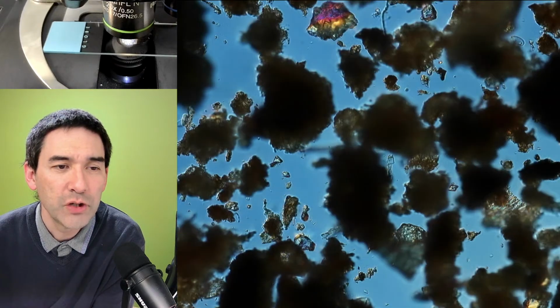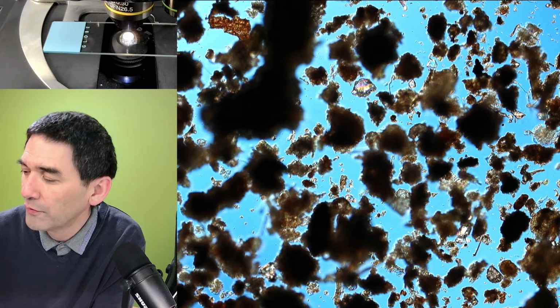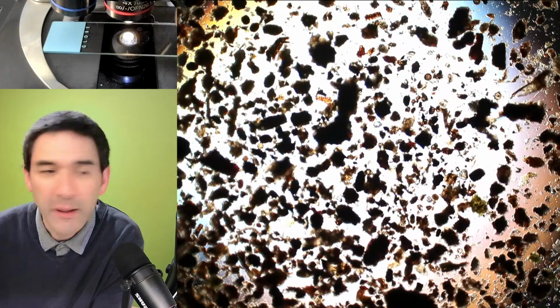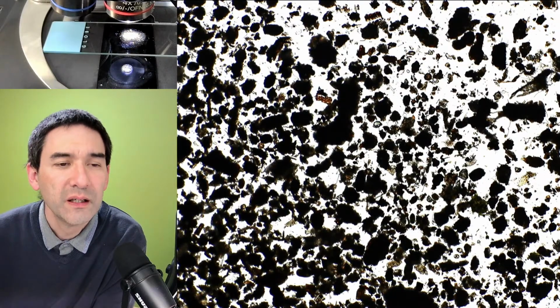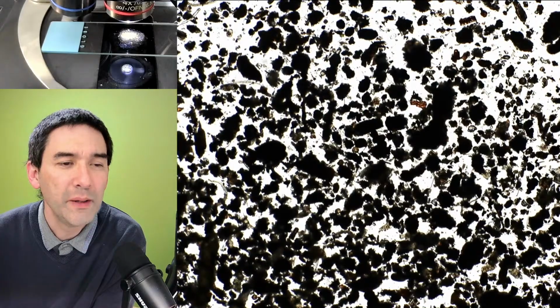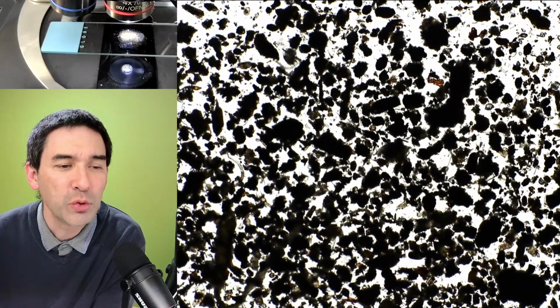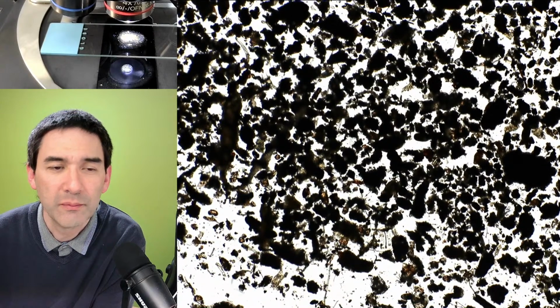Let me quickly have a look. Every time you want to get a better overview, you might want to go down with the magnification. So I'm going to remove this here again. Another thing that I sometimes recommend is, even if there does not seem to be much going on, make a time-lapse video, and then you're actually going to see how much movement there is.